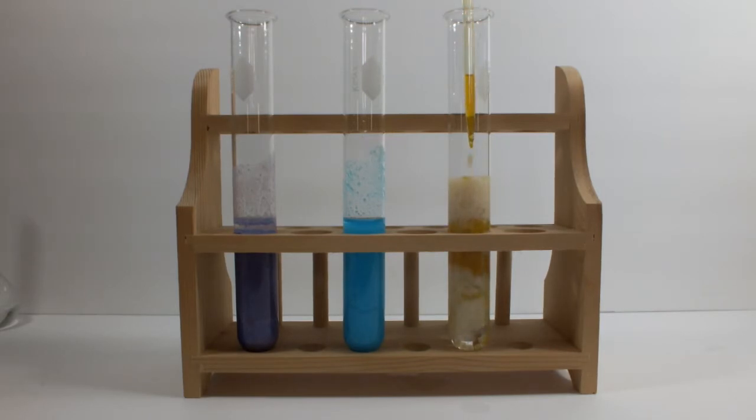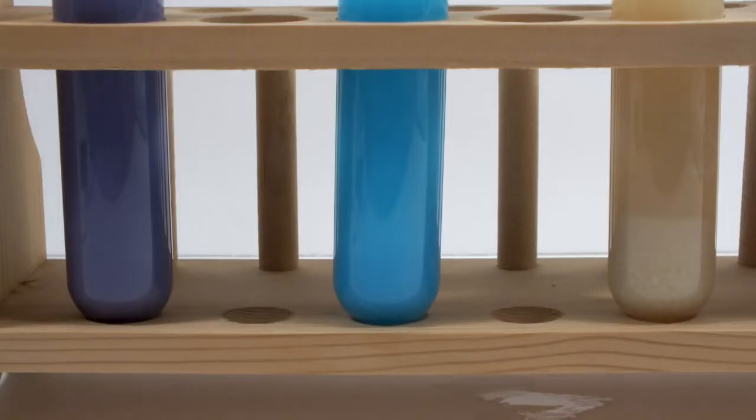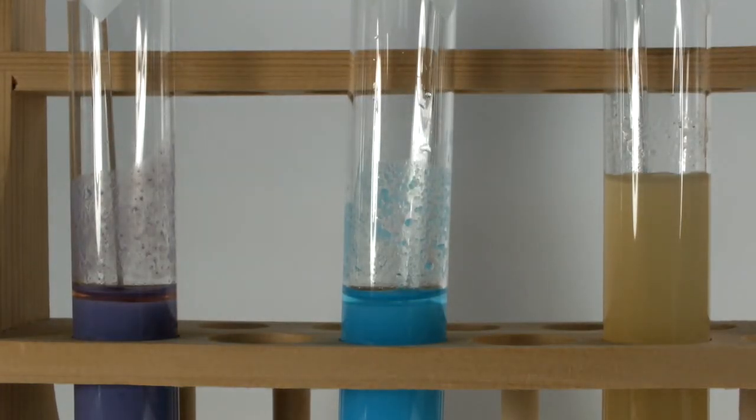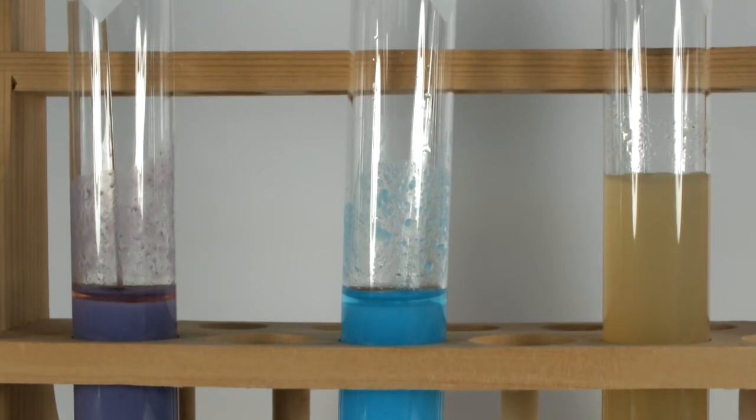I'm going to leave them all to settle for a little while, and then filter off the precipitates. As fluffy as that iron precipitate is, you can see it's settled right down. The other two are taking a little bit longer. This is also the point at which I noticed that the solutions still have a considerable color to them.